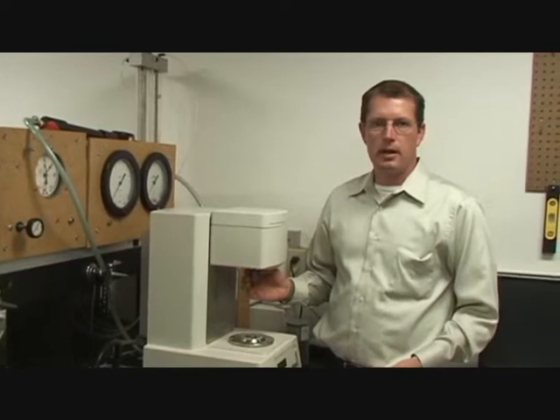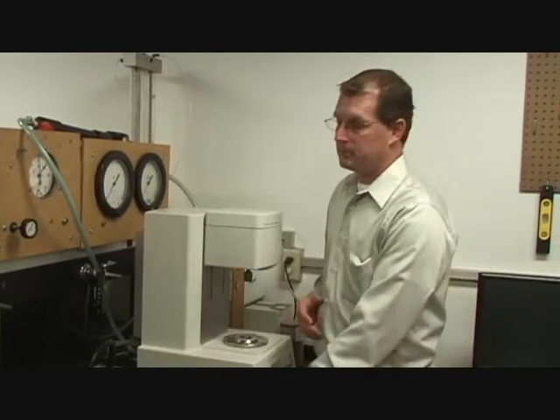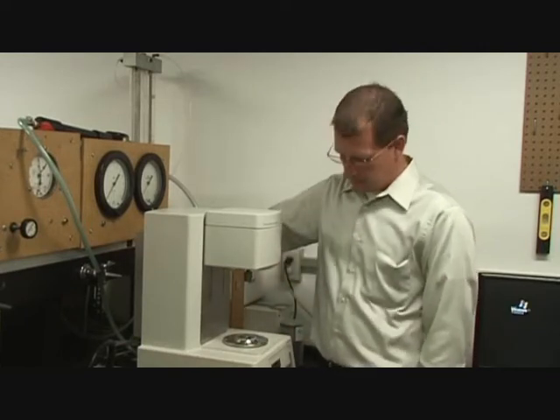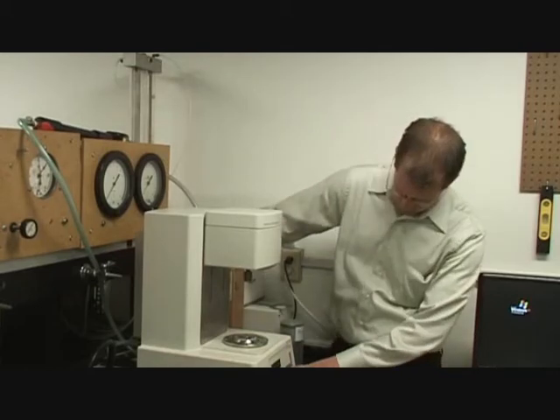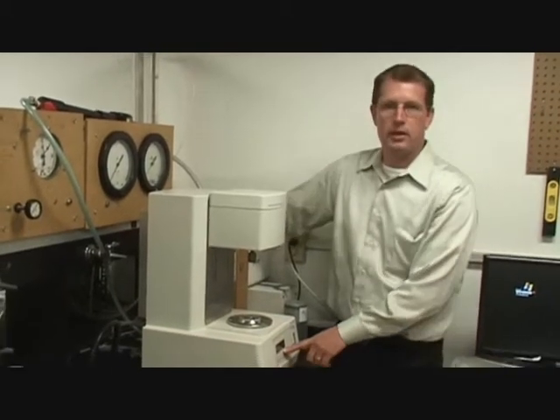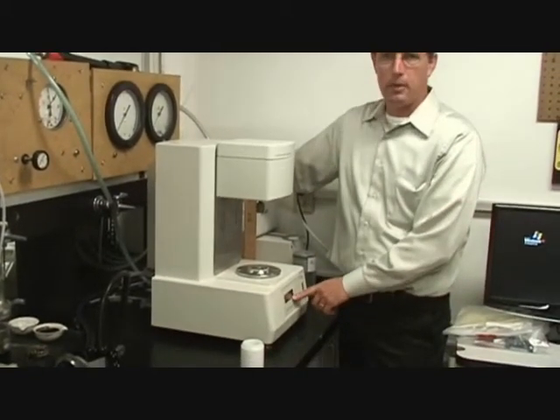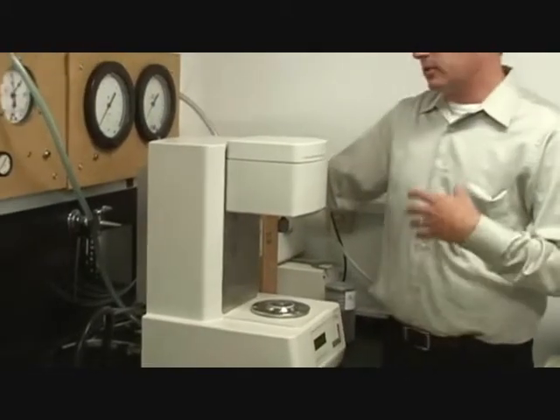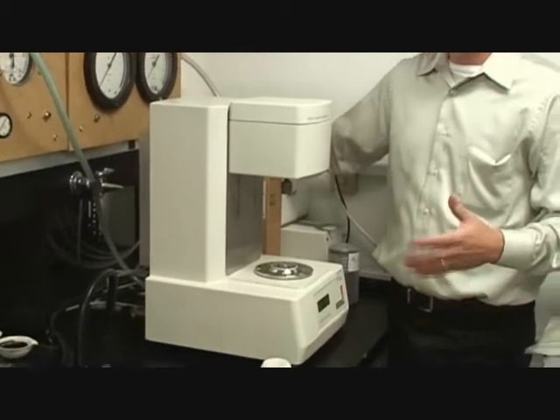The rotational part is on an air bearing. It's actually floating on air right now. Air is critical. Right now you have the air pressure on. That's good. I know it's on because I can look at the little status bar at the bottom of the front. Right now it doesn't say no air pressure. As long as it doesn't say no air pressure, you're good.